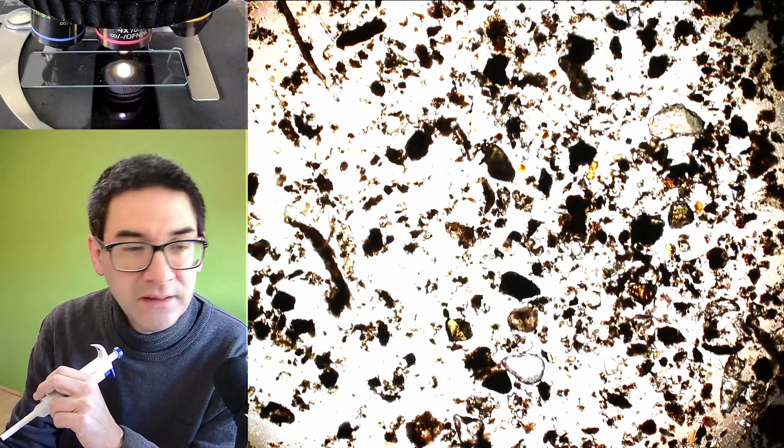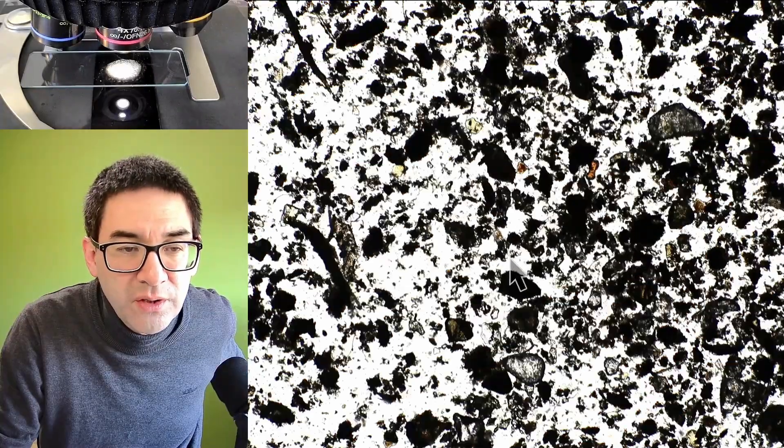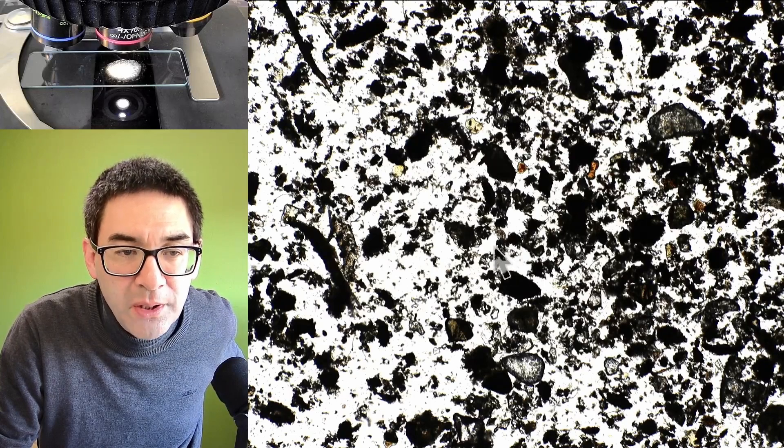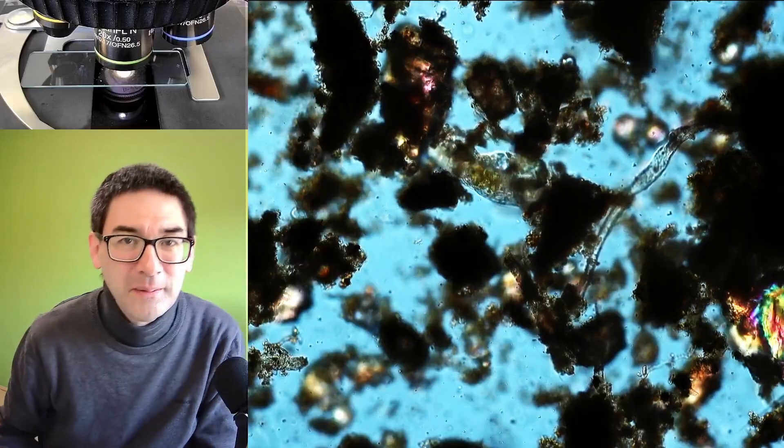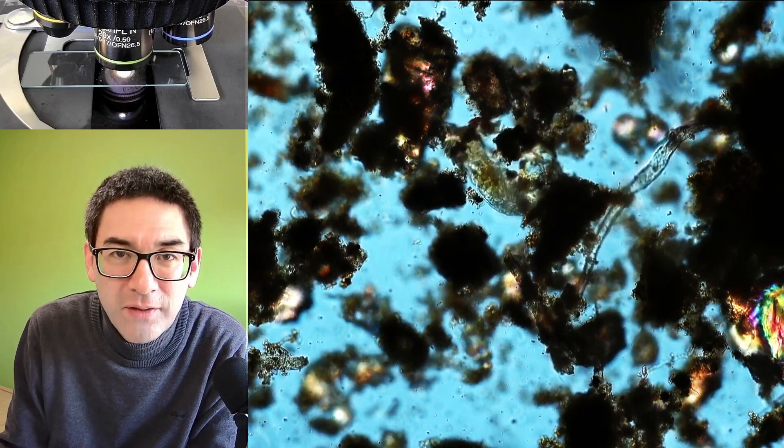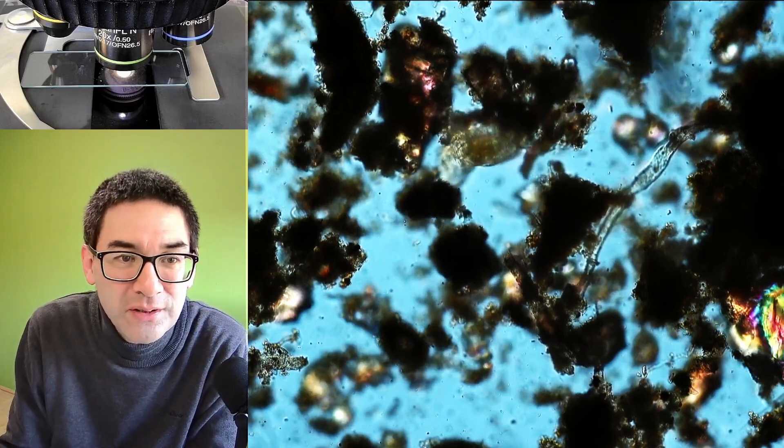So I'm gonna go down with the magnification again and this really requires now a very steady hand. You see it over here, that's basically the tardigrade that I would like to pick up using my pipette. But this is of course a very risky thing because usually during the transfer if I'm not careful I might actually lose the tardigrade.